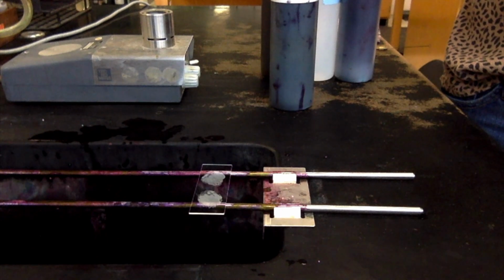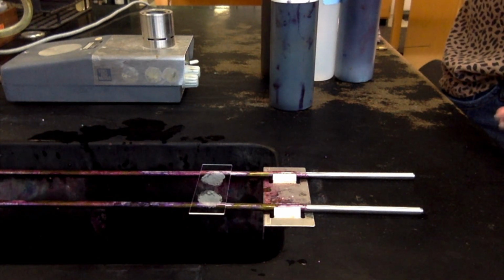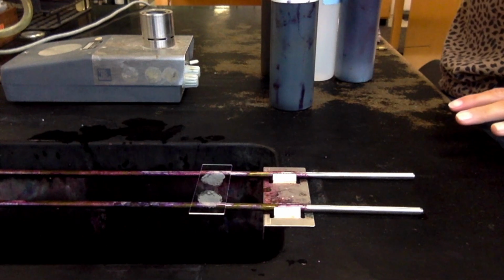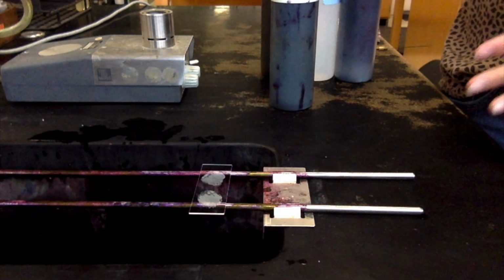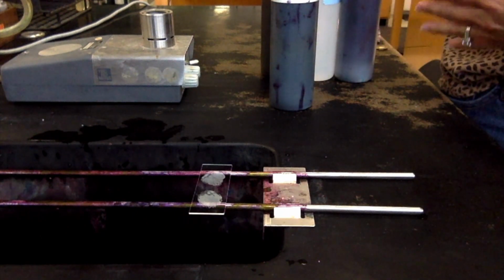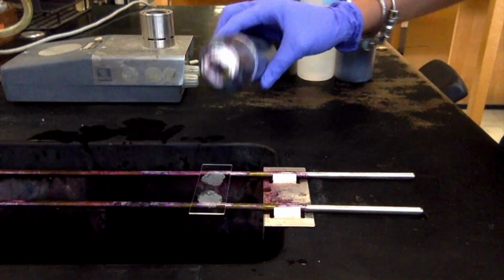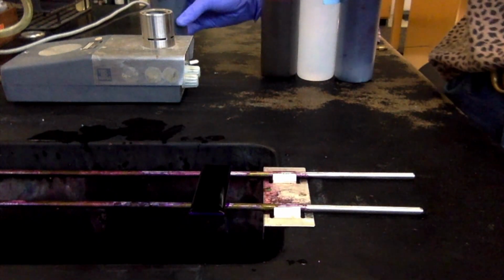in the gram stain. And now there are other differential stains. The gram stain's not the only one, and they all have those 4 main steps: primary dye, mordant, decolorizer, and secondary dye or counterstain. So we're going to do other differential stains in here, and so they're going to also have those 4 main steps, except the dyes themselves are going to change. So we're going to flood the slide with crystal violet, and we're going to let that sit for 1 minute.